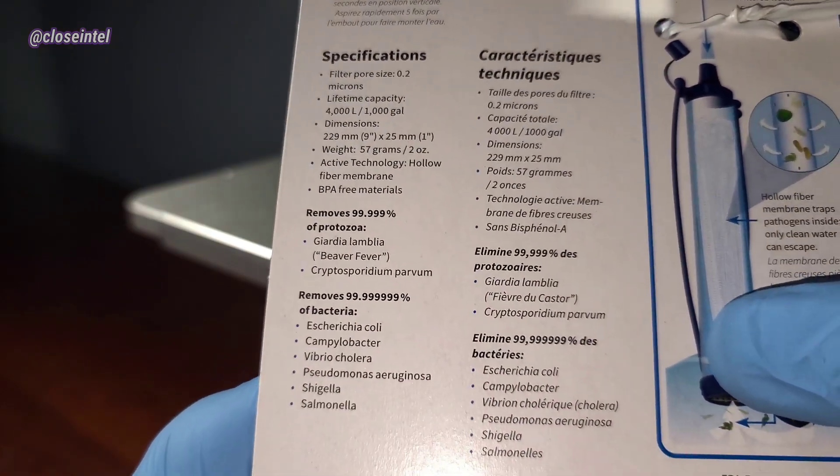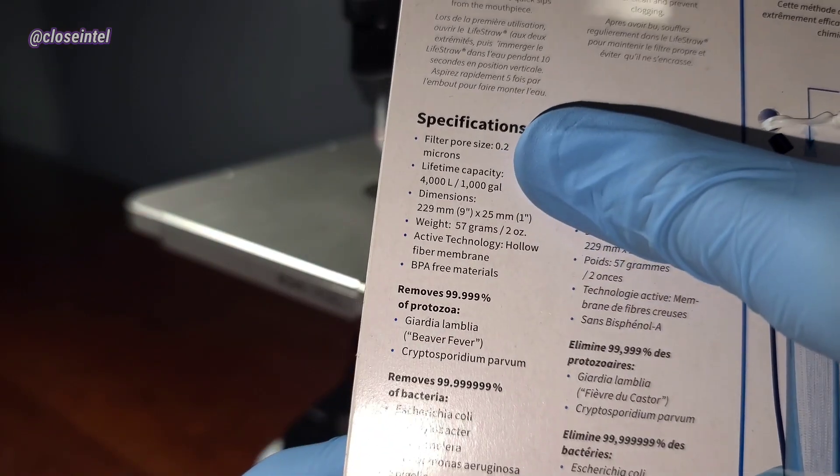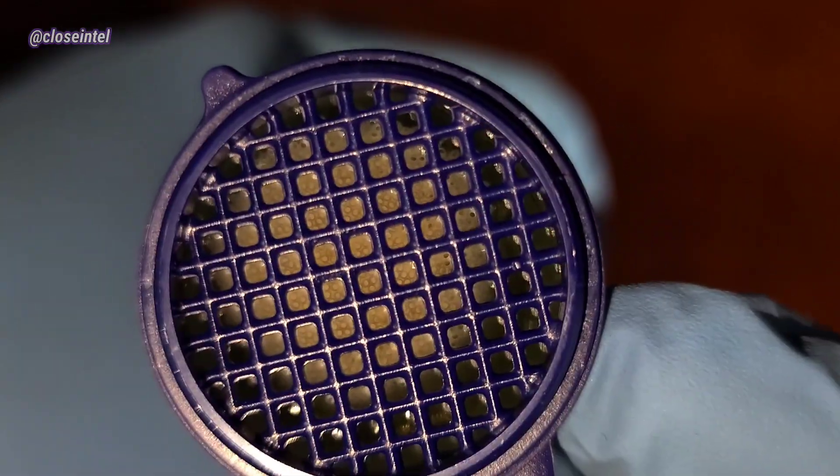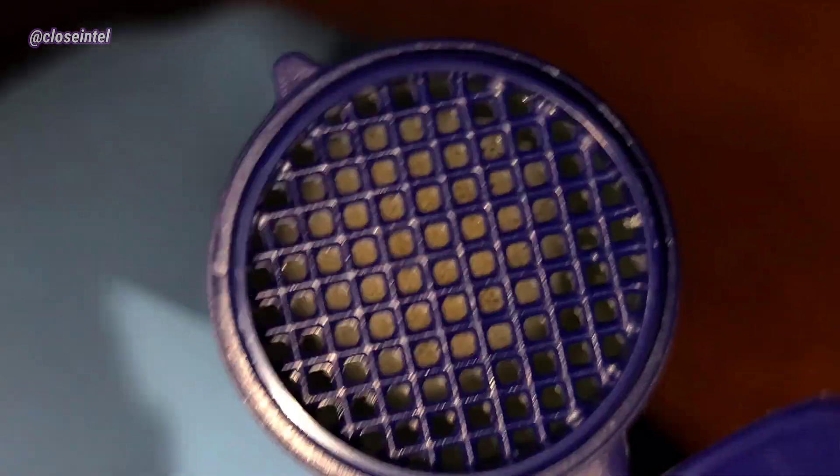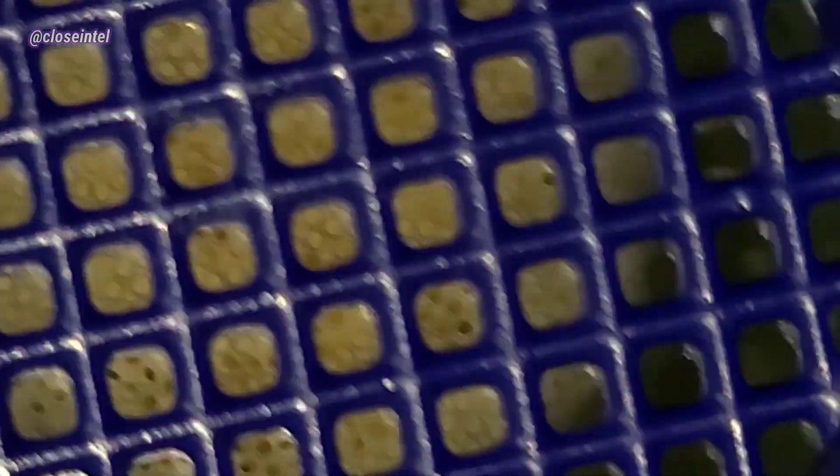Today we're going to be seeing if LifeStraw really works. Out of all the requests that I get, this is definitely one of the ones that I get the most often. This is the end of the LifeStraw that you stick in the water and you can see the first layer of the filter here.